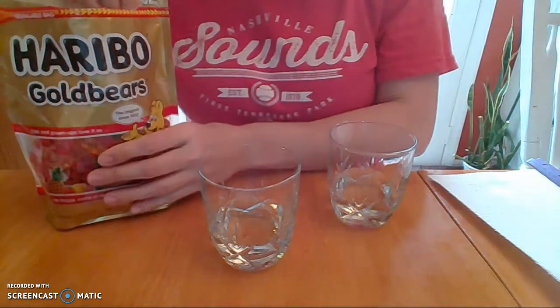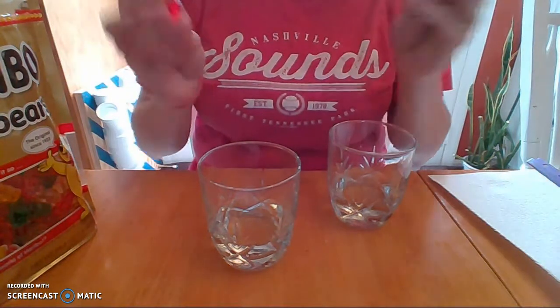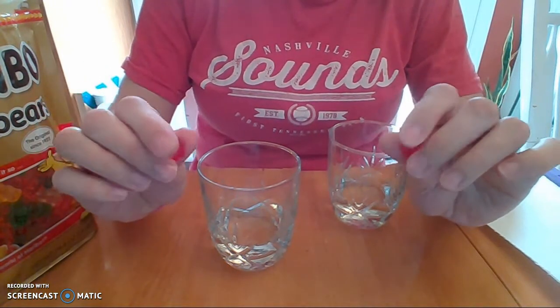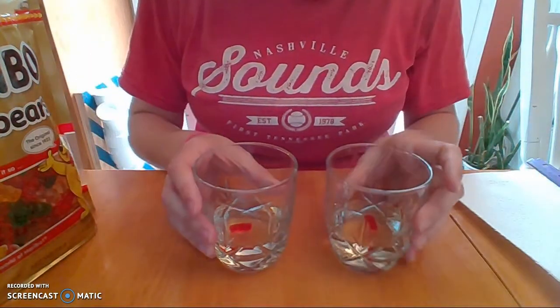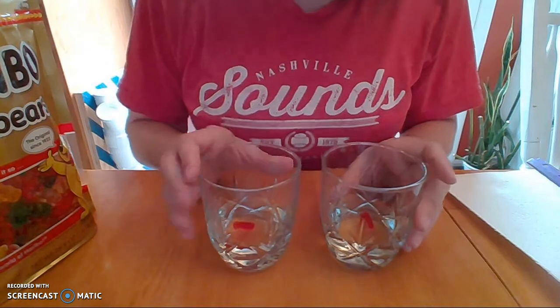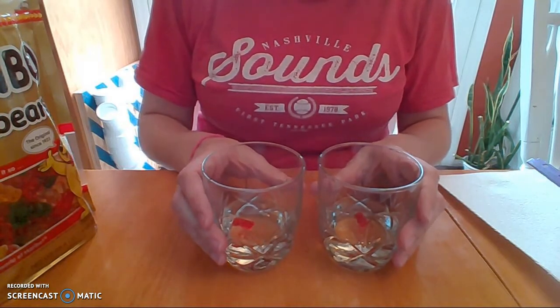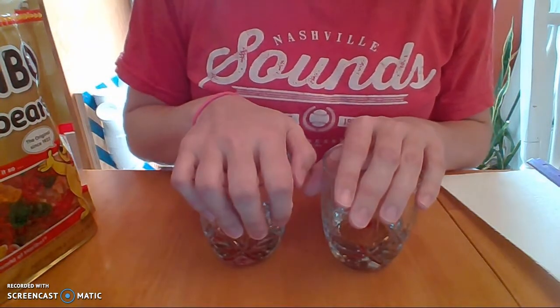we are going to take our gummy bears. Just going to grab 2 red ones out of here and just kind of show you the size. Pretty solid, not very flimsy at all, but we're going to drop these in there. Both of these have sunk to the bottom just right off the bat. So we're going to leave these for 6 to 10 hours just to soak, and we're going to see what happens with these.